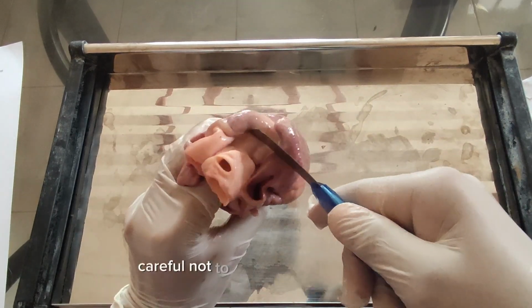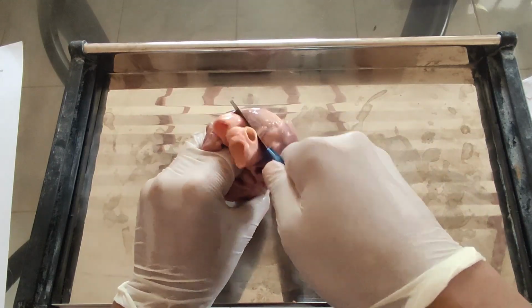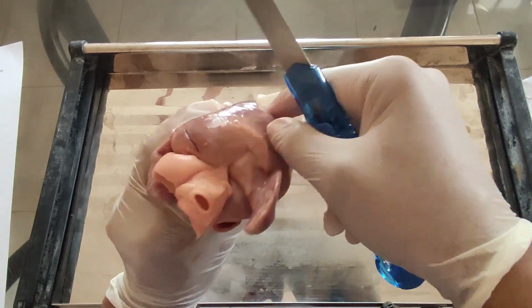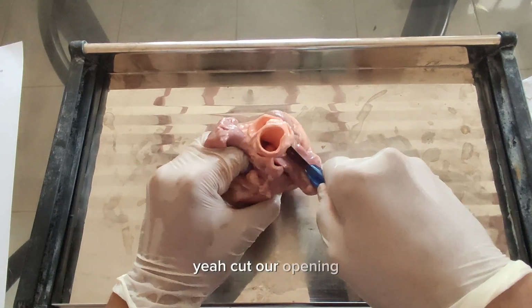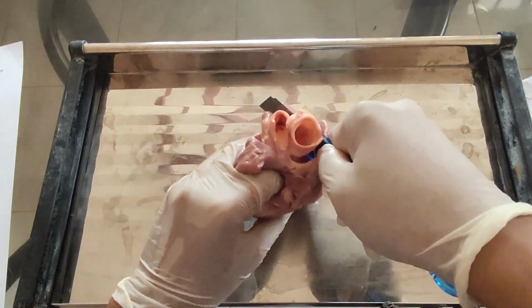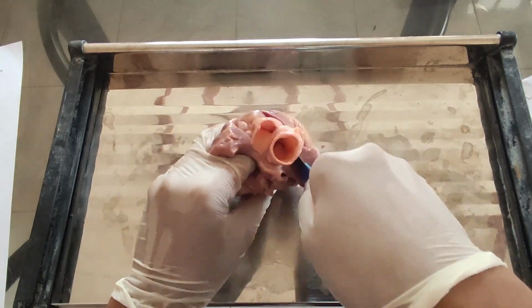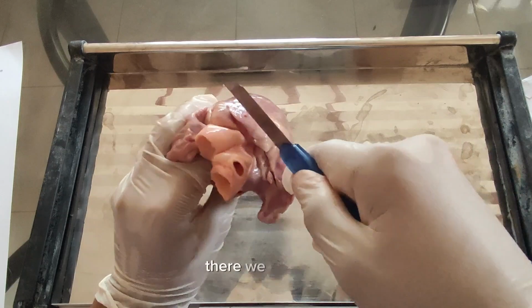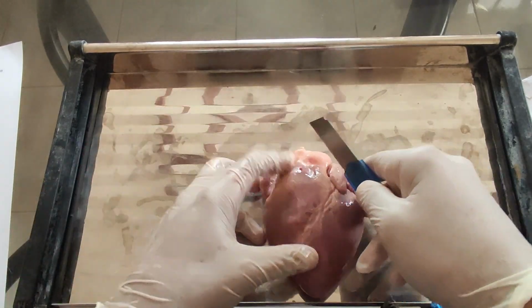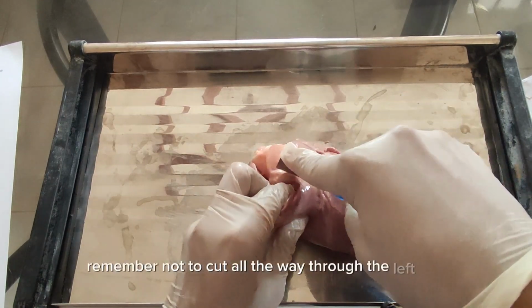Careful not to damage the other parts. There, we'll cut our opening. There we have it. And just cut all the way through here, just on the right ventricle. Remember not to cut all the way through the left one.